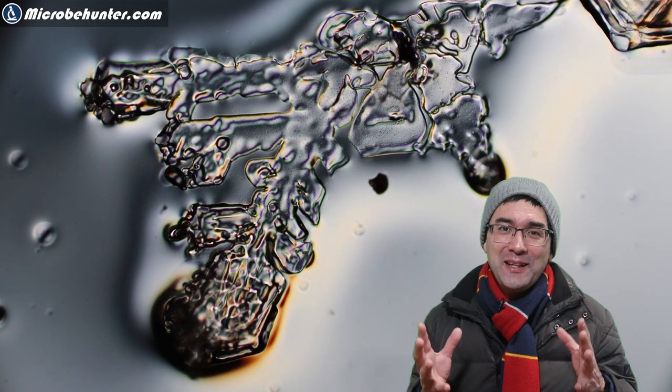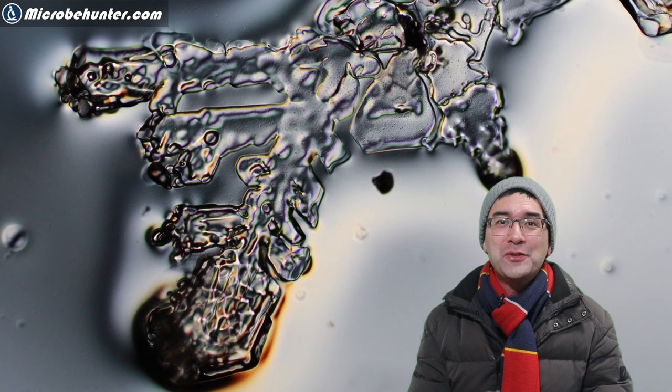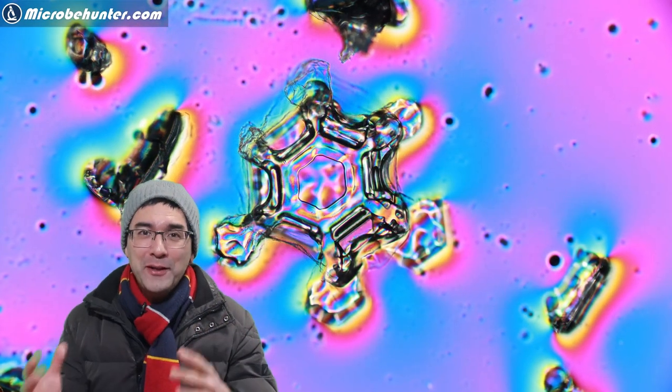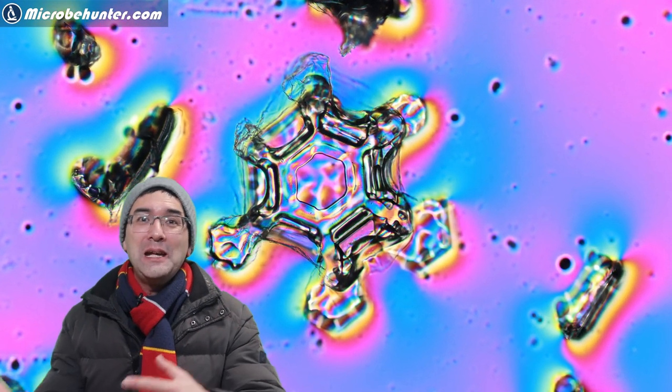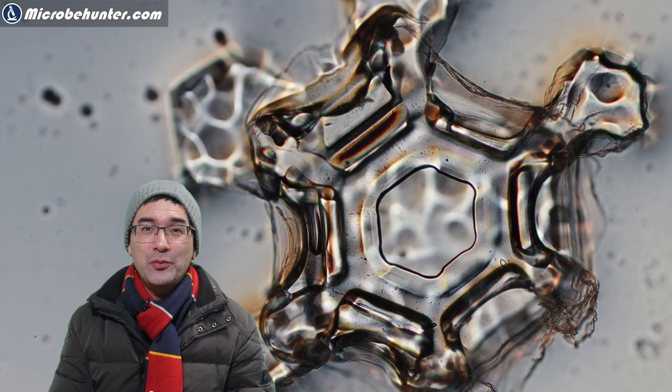Today in this video I would like to show you how you can also put snowflakes under your microscope without having to take your microscope out into the cold or snow into your home. There is actually a little trick that I would like to share with you today and then you're able to see those beautiful structures.